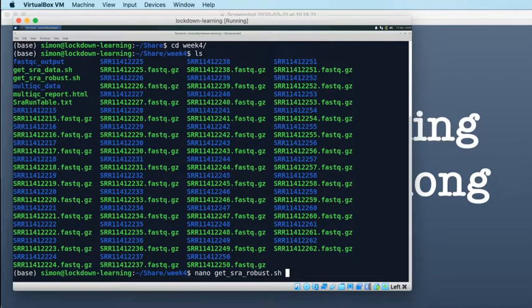And in trying to do this, I discovered 2 things. So the first thing that I discovered was that those file sizes are very slightly different to the sizes of the SRA files that you download using Prefetch. So I used Prefetch to download the SRA file.